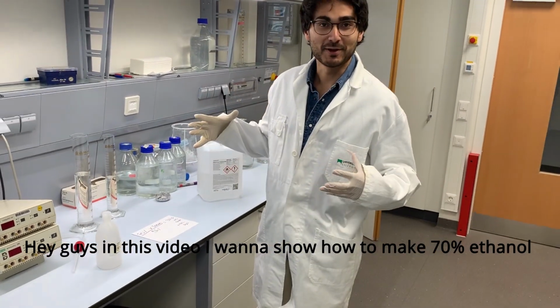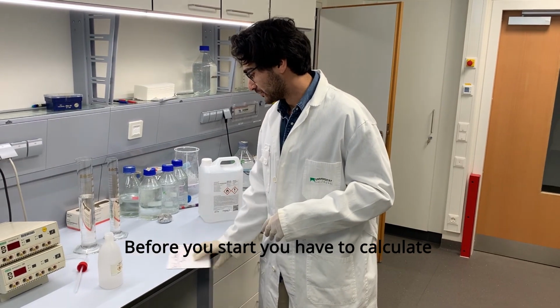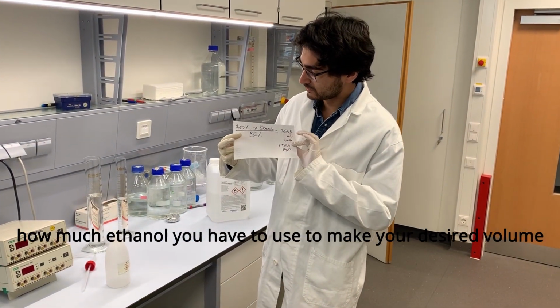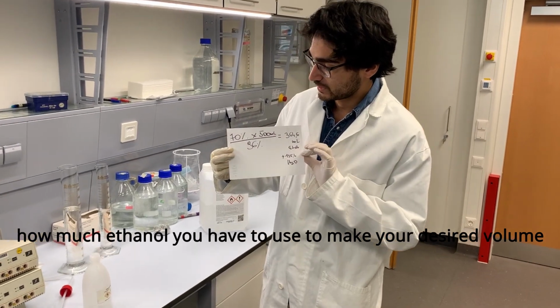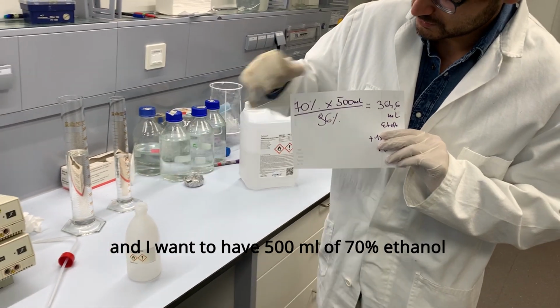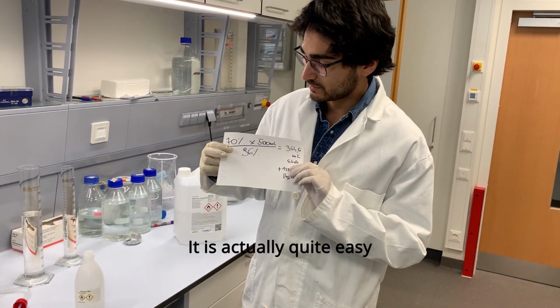So hey guys, in this video I want to show you how to make 70% ethanol. Before you start, you have to calculate how much ethanol you have to use to make your desired volume. In this example I decided to fill up this bottle and I want to have 500 milliliters of 70% ethanol. So it's actually quite easy.